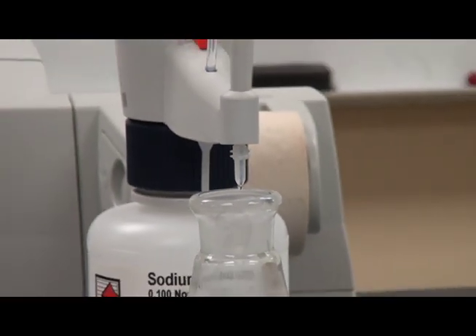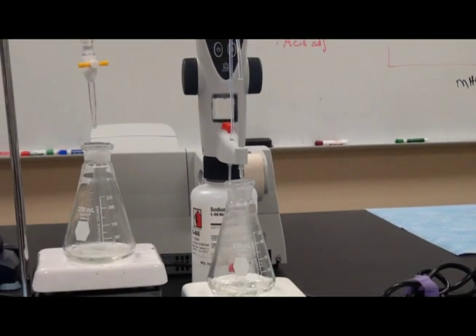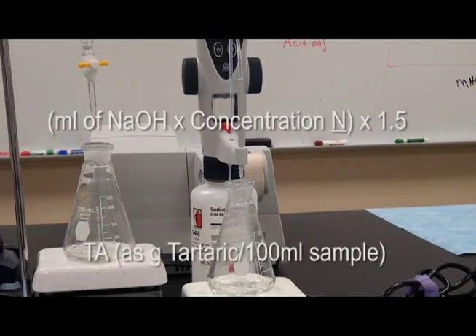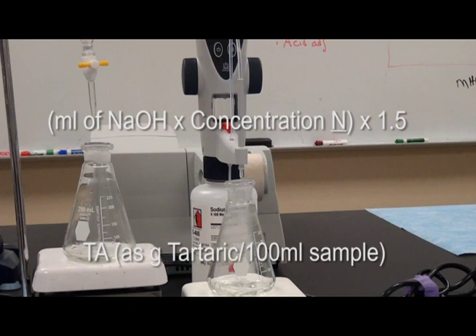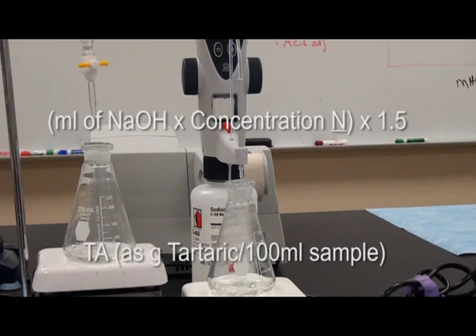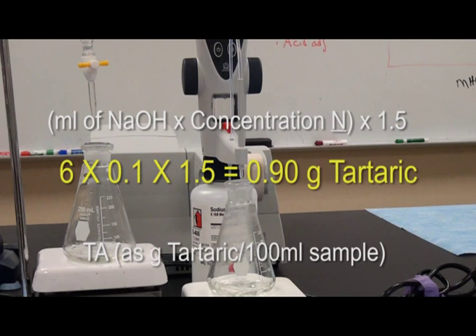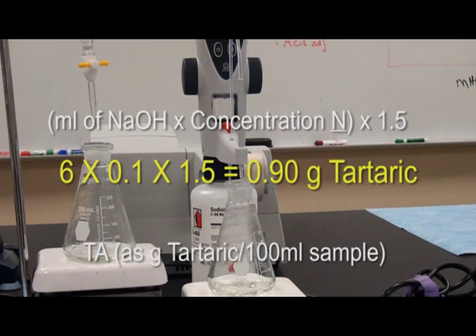The titratable acidity is calculated using the following formula: TA as grams tartaric per 100 ml sample equals the number of milliliters of sodium hydroxide used in the titration, times the concentration of that sodium hydroxide (N), multiplied by 1.5. In this example, 6 ml of 0.1 N sodium hydroxide times 1.5 equals 0.9 grams tartaric.